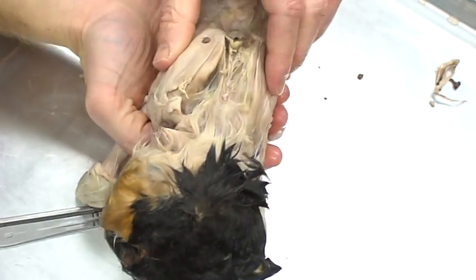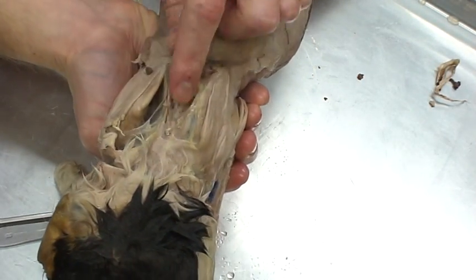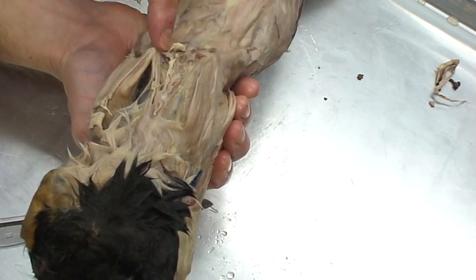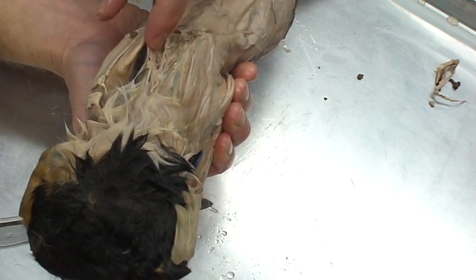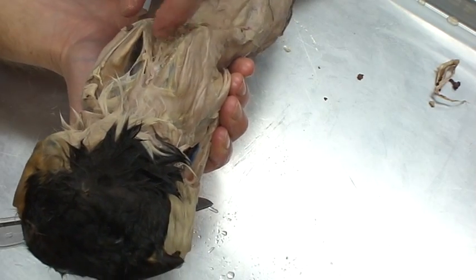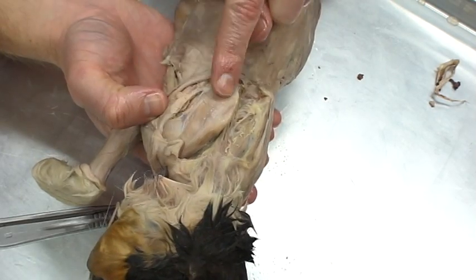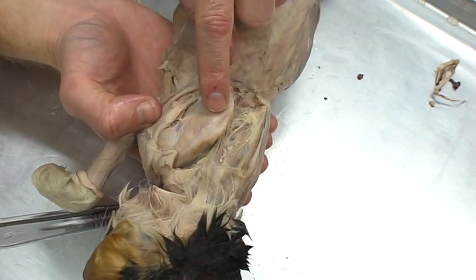What we did is we split the trapezius muscles — split into the shoulder itself just very lightly. We took a look at these strings that tied to the medial portion, the medial aspect of the scapula. These right here are going to be your rhomboideus muscles. If I pull away the trapezius a little bit, I'm going to find the supraspinatus muscle.